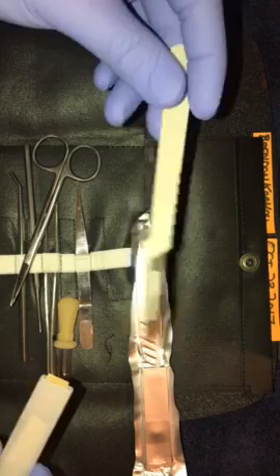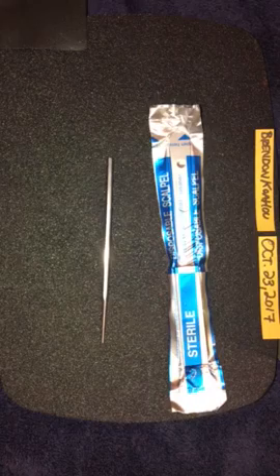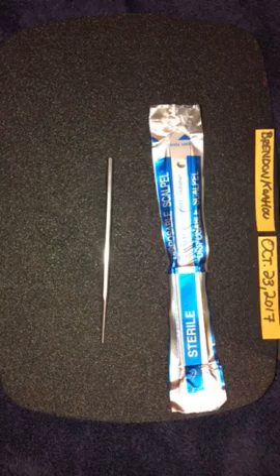We're gonna need a fresh scalpel today because I used this last one to cut into some molding clay and now there's molding clay all in that blade. I wanted to keep this other scalpel just in case of an emergency and put it in like my bug out bag or something. So what I'm gonna be using is my scalpel — fresh, brand new, obviously. I'm gonna be using this tool, I don't know what it is, to point at stuff. I really don't need anything else in here, so I'm just gonna be using my scalpel.